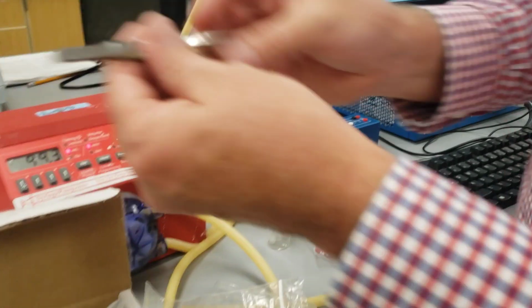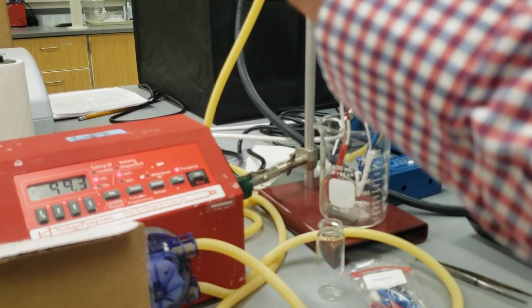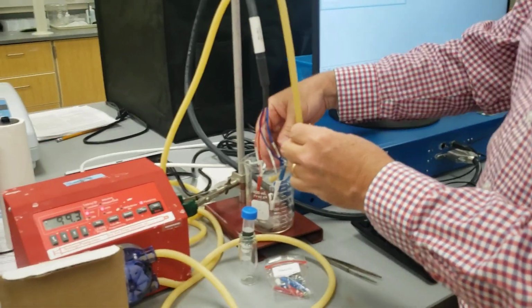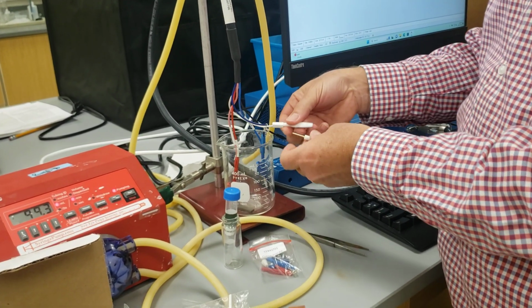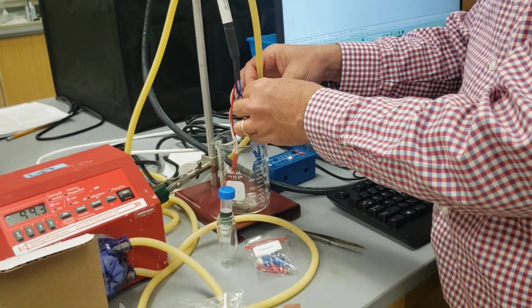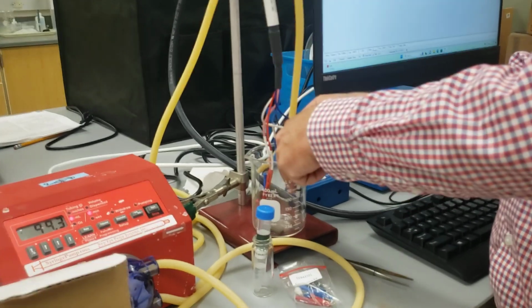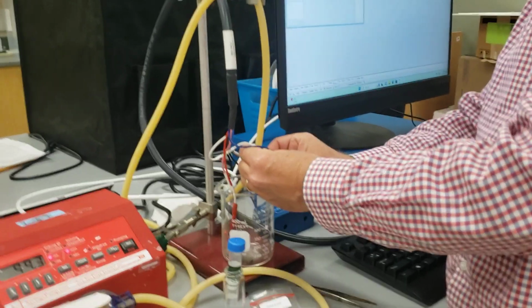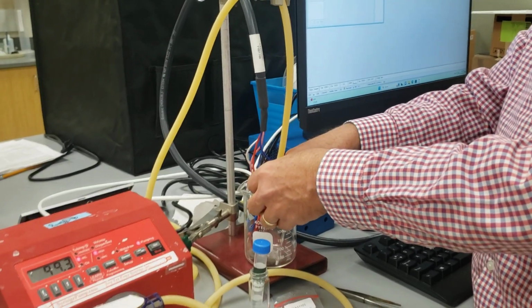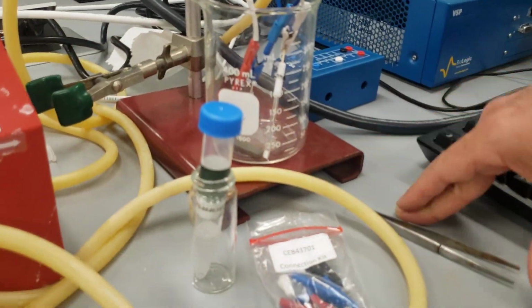And then the reference electrode, I'll use these tweezers here to pull it out. You don't need to, but you don't want to spill that solution. That's a nice solution we want to keep. We don't want to have it spilling to the side. This is our reference electrode. We'll clamp the reference electrode on like that, and that can be poised in place. There we go. If we put the reference electrode touching right up against the working electrode, keep those nice and close like that.